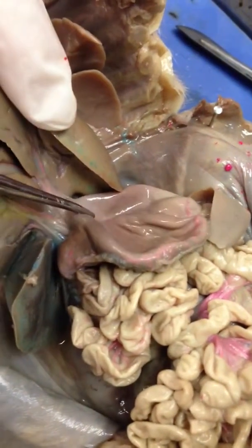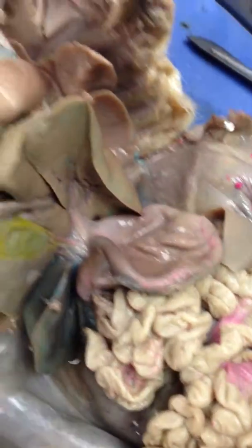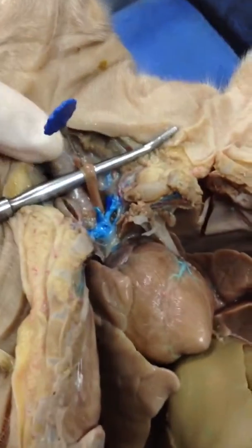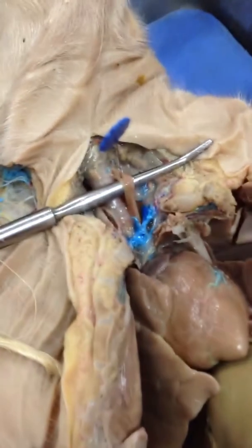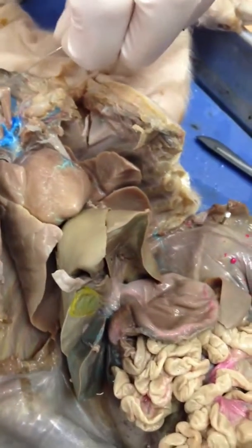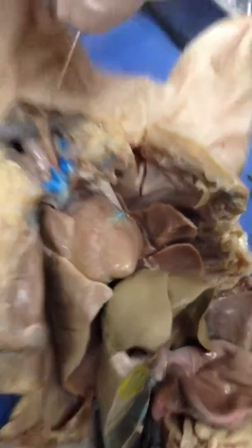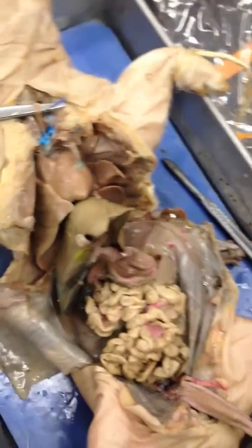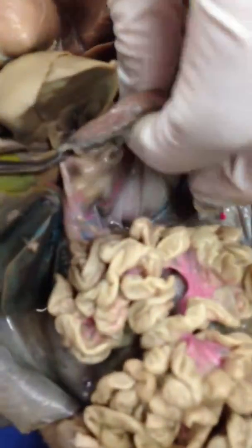If you were going to pin the esophagus, what would it look like? If you were going to put a pin in the esophagus. I could do this. Yeah, do that. Esophagus. What organ, or structure, is that? Esophagus. Yeah. So let's do that. And that's right next to the trachea? Mm-hmm. And you can tell that this is the trachea because it has the ridges. This is the esophagus because it's next to it and it looks something like that. So then here's the stomach again.